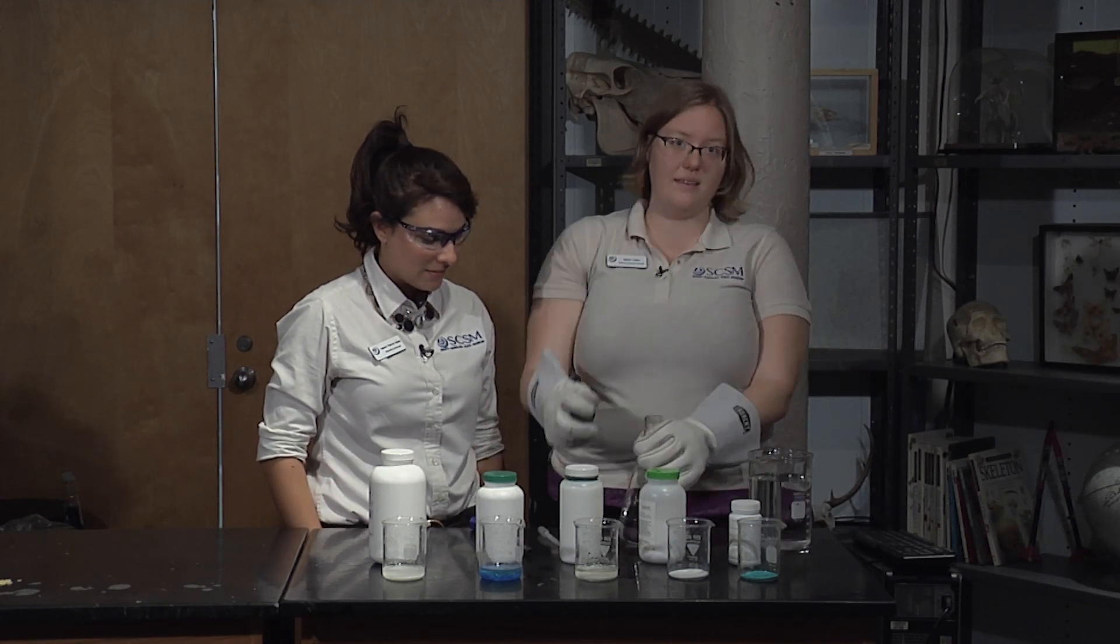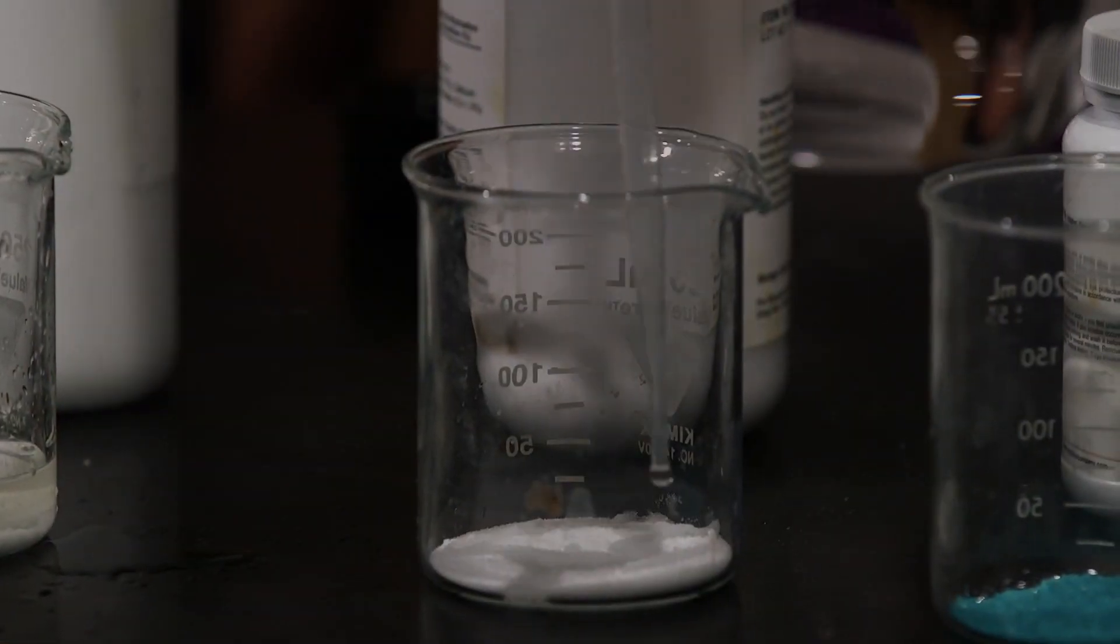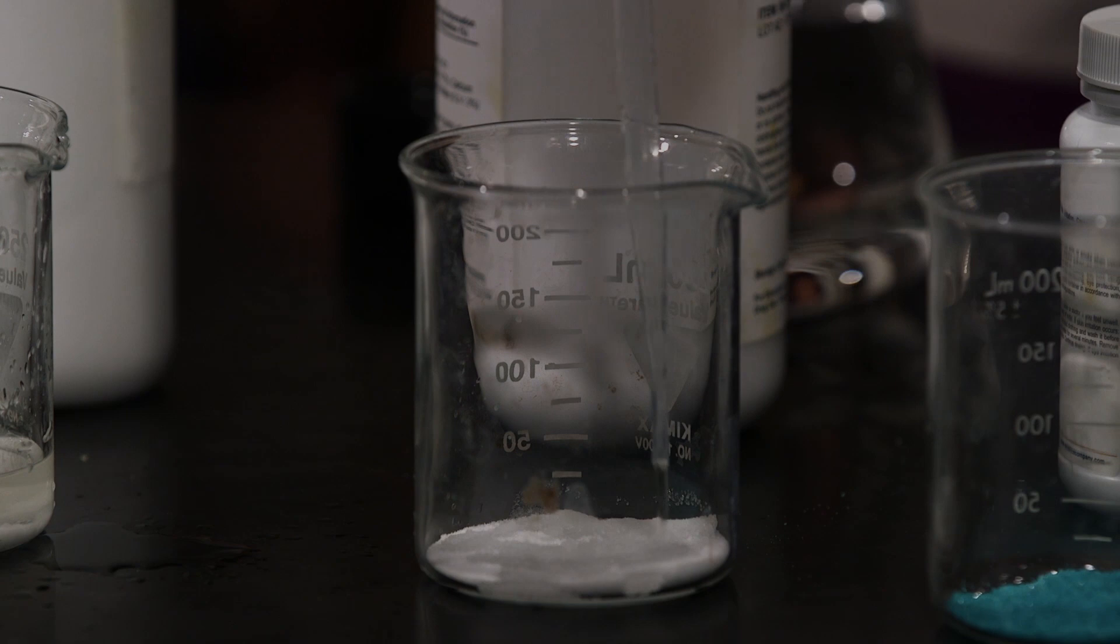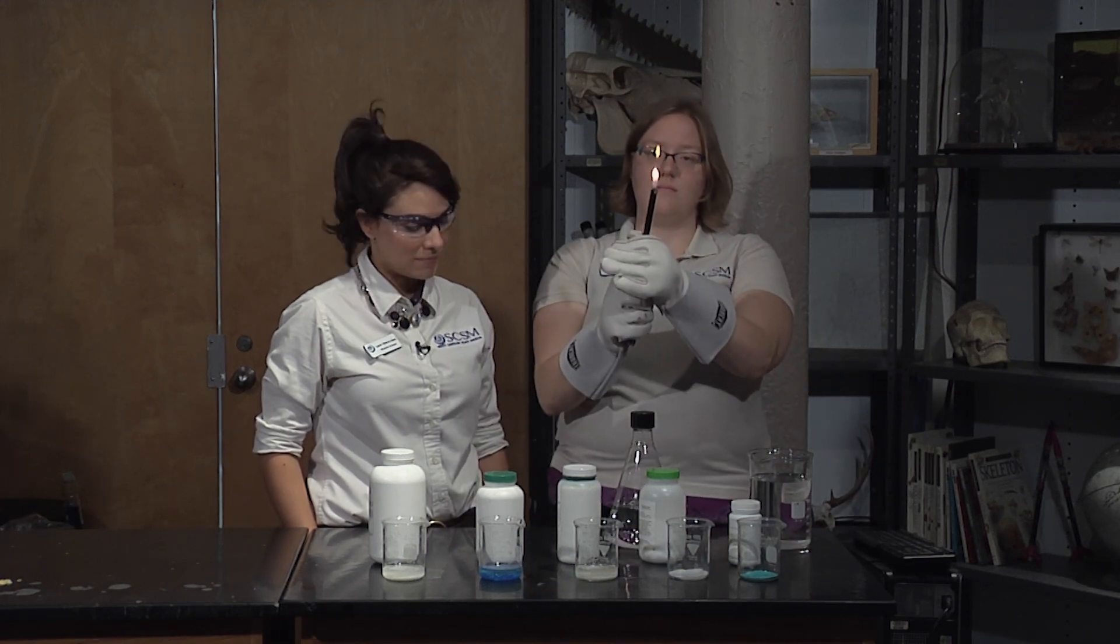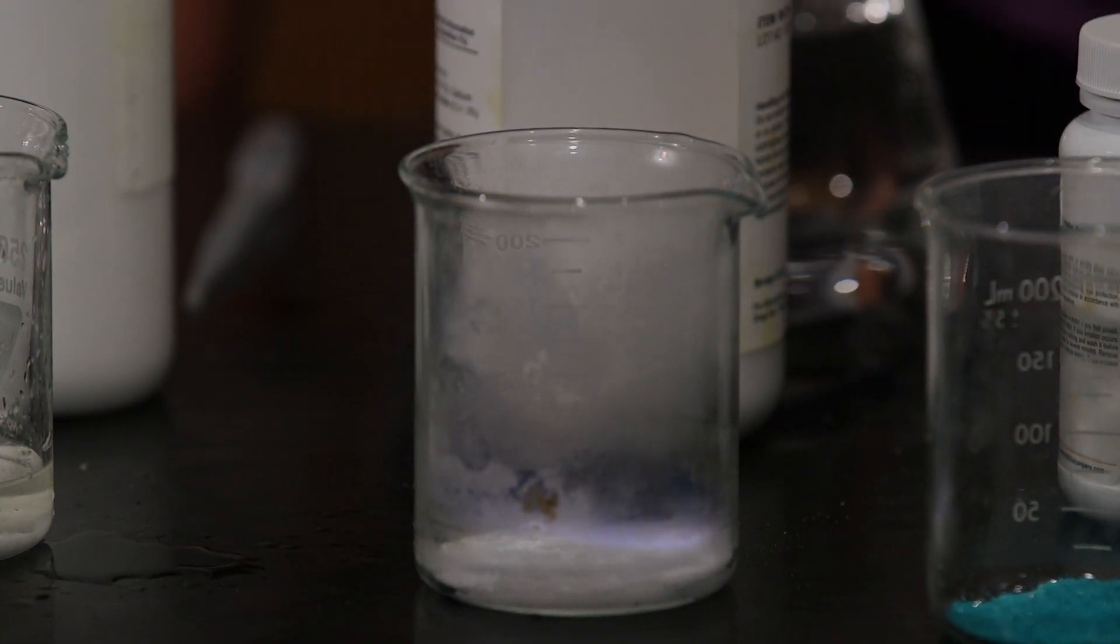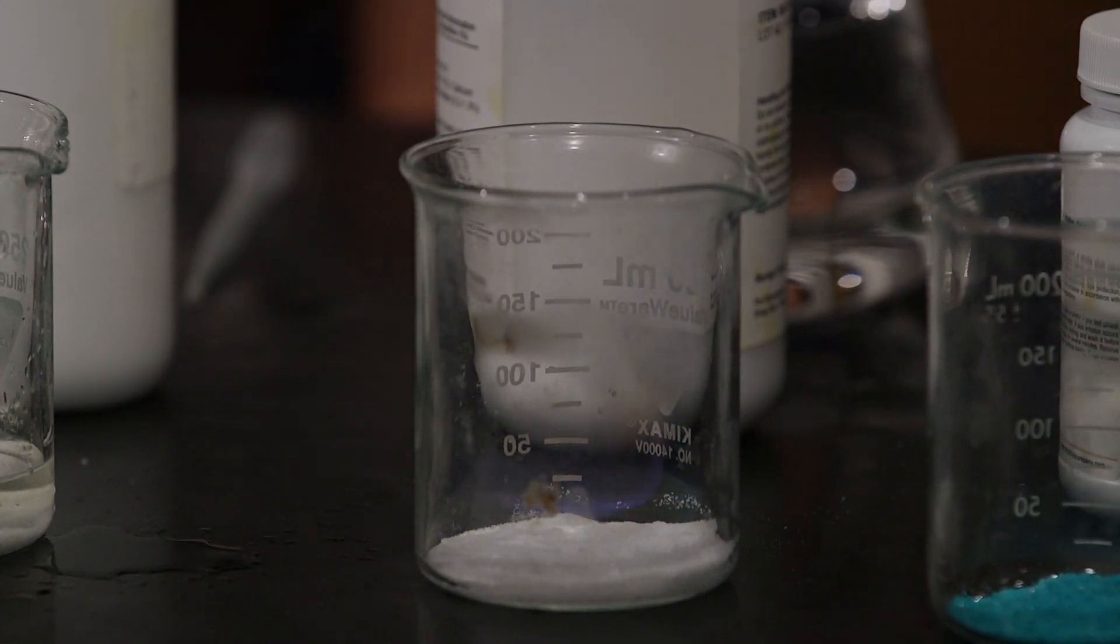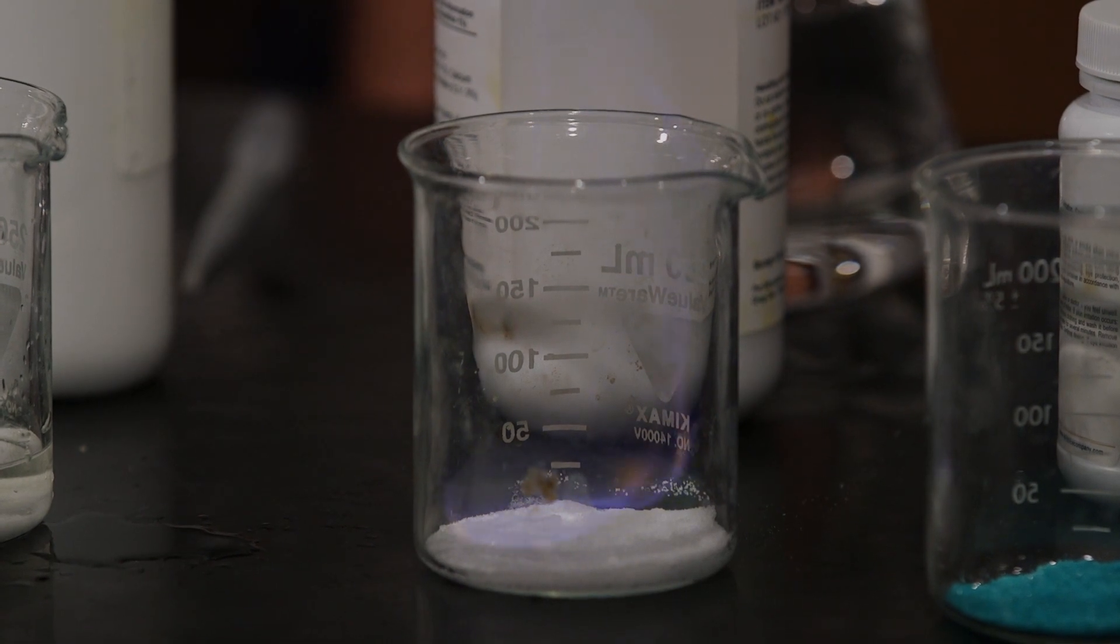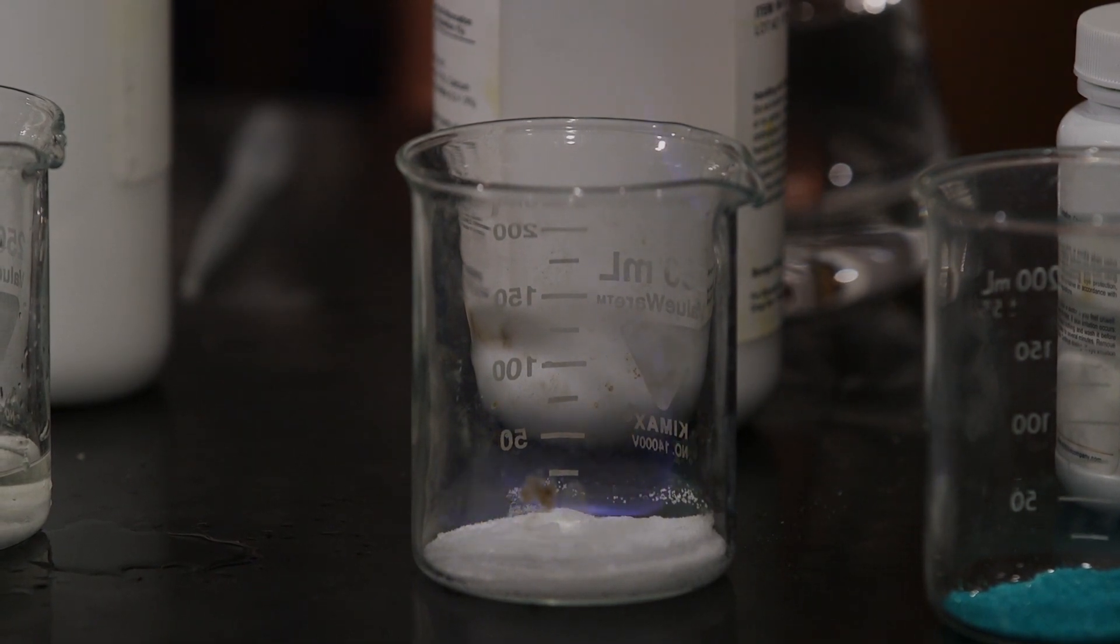Next is our potassium chloride. This one I think is even finer grain. Yeah, it's really tiny. So we've got some blue. I'm gonna give it a second. Is that one yellow? There's a little bit of orange coming through in the bottom. This one always likes to be a little bit blue at first. Oh yeah, you can see it. Awesome. Here goes the water.